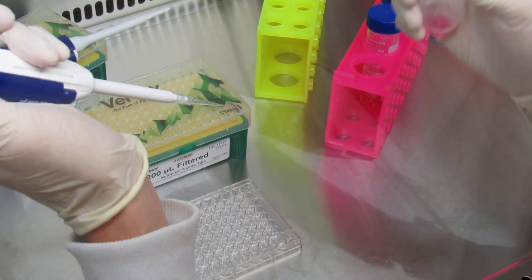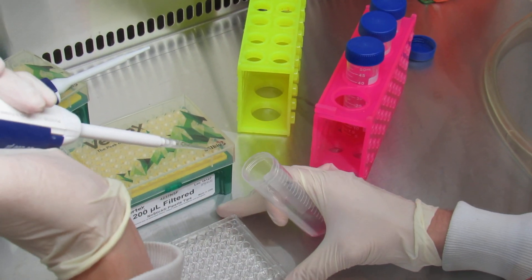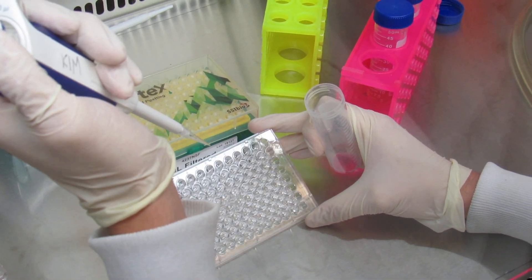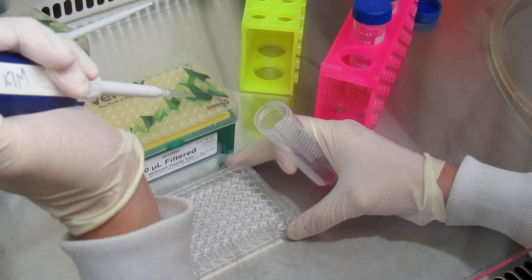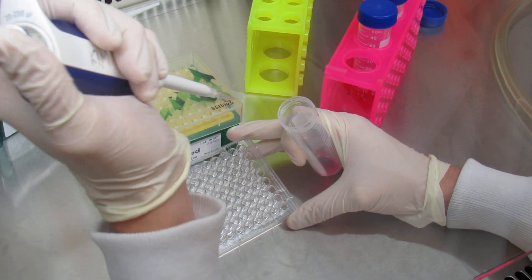What I always do is I hold my stock in one hand. With that same hand, I tilt it forward so I can see the empty wells. Otherwise, it's very hard to differentiate which wells you have inserted into and which ones you haven't.